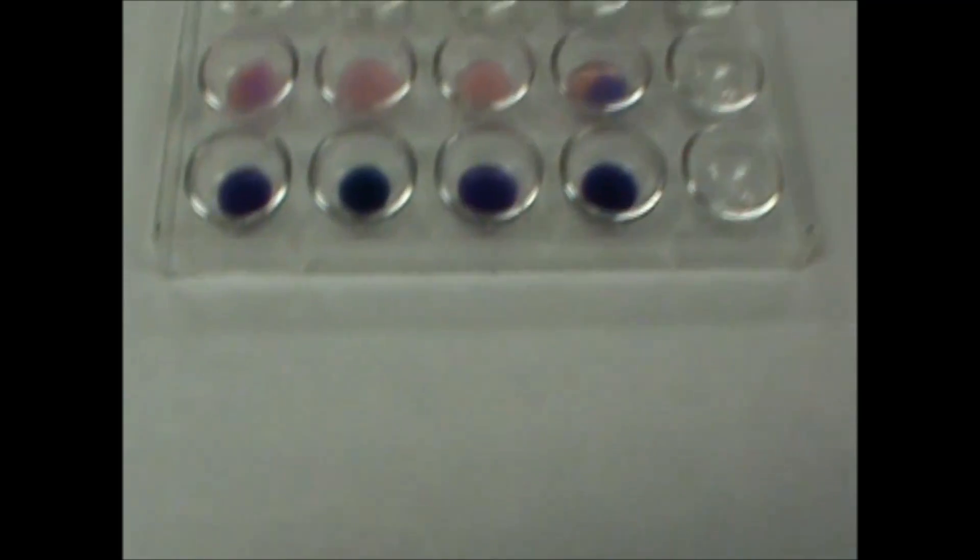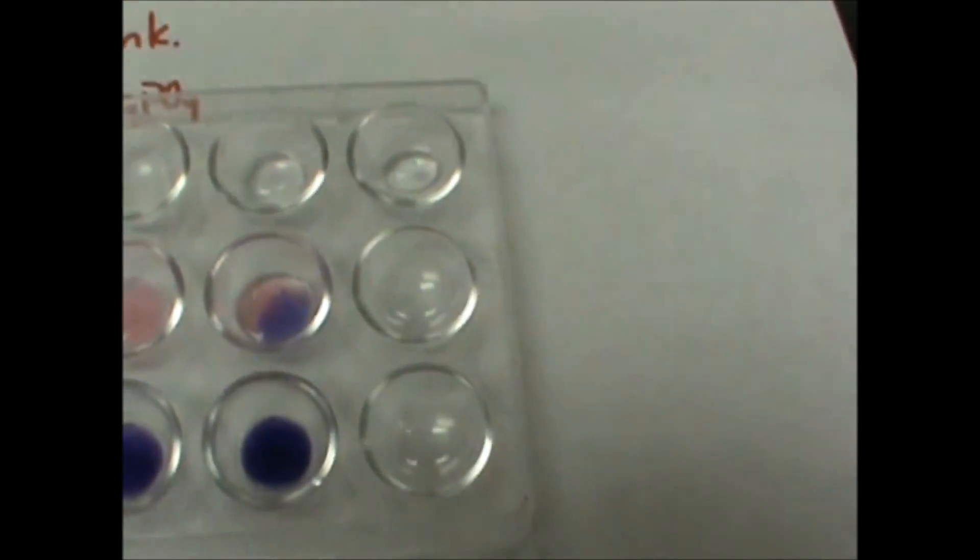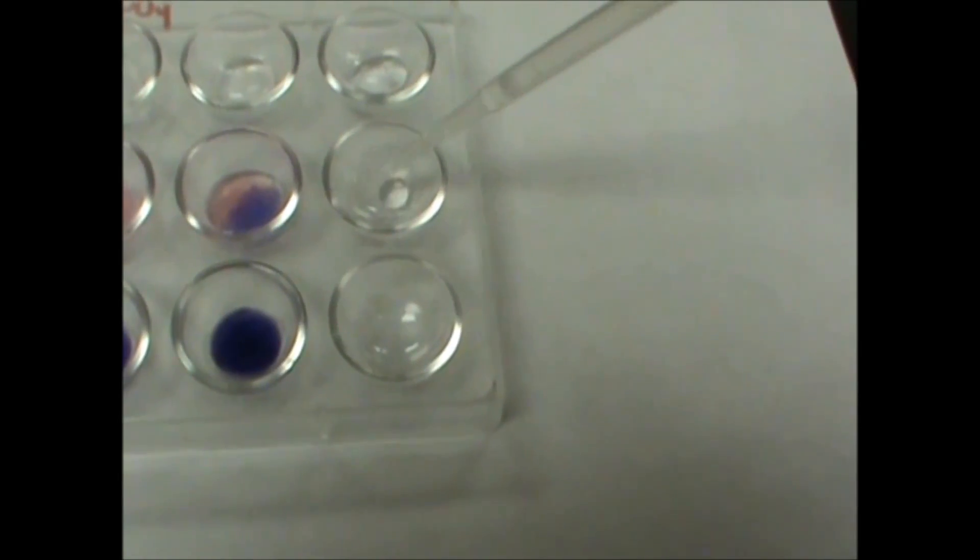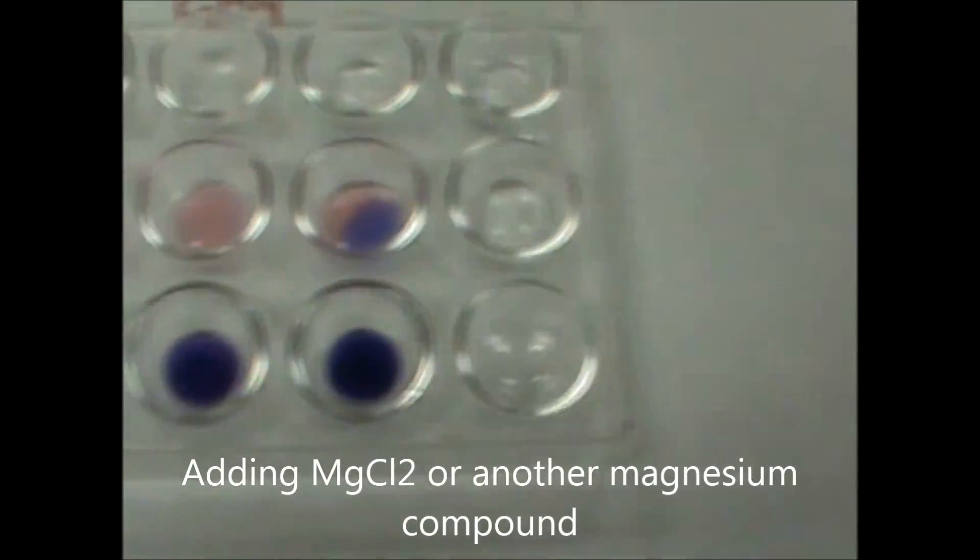And then the last thing you can do is if you take a carbonate here and I put a bicarbonate here, you can add magnesium to both, and only the carbonate will precipitate.